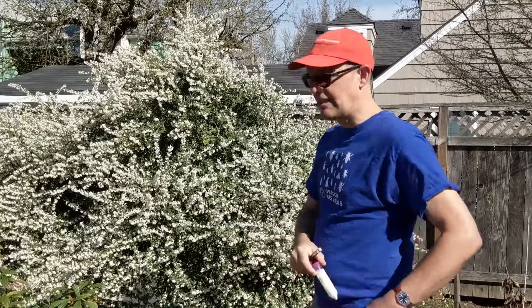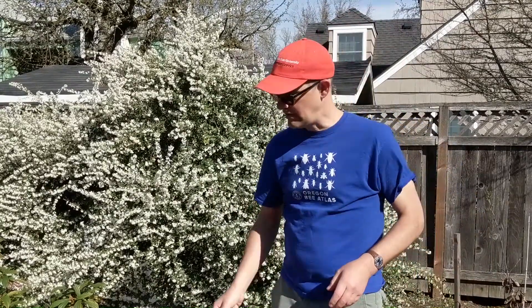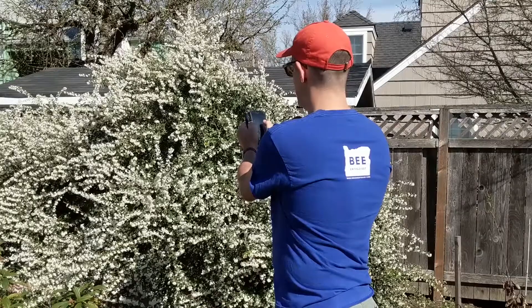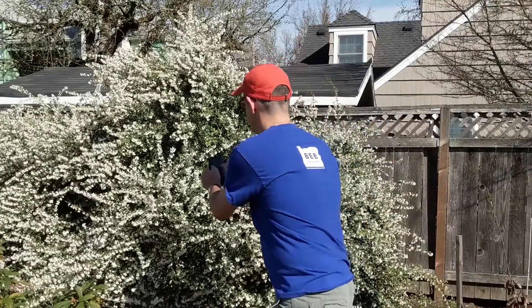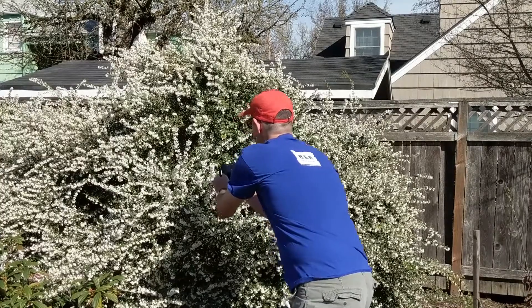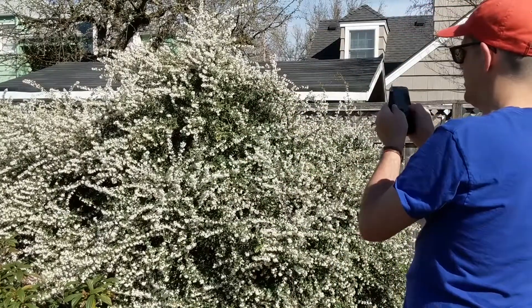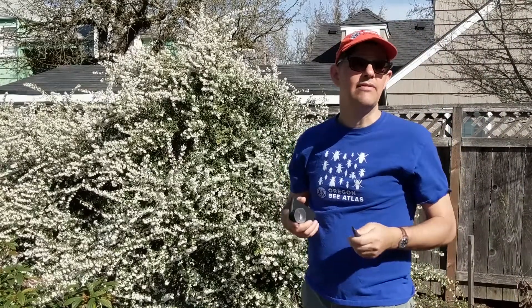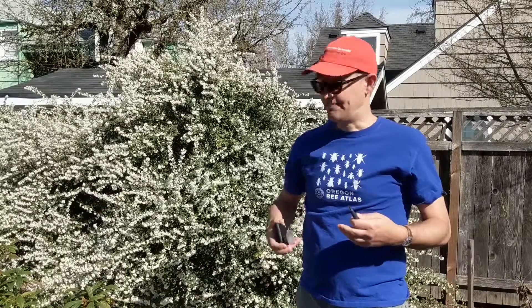The next thing I'm going to do is take my phone out — I use iNaturalist, though you could use a notebook as well to record this event. I get my phone out and bring up iNaturalist, take a close-up of the flower, a close-up of the leaf, and stand back for a close-up of the whole plant. Then I bring up all the fields in iNaturalist so that I can record this as sample event number one. Now it's time to catch my bee.